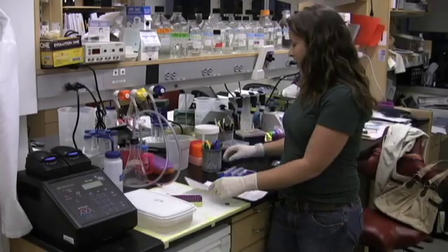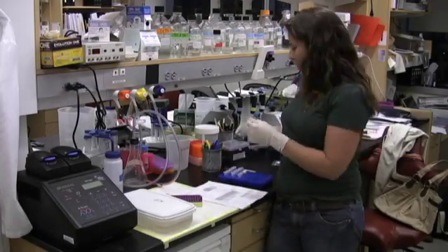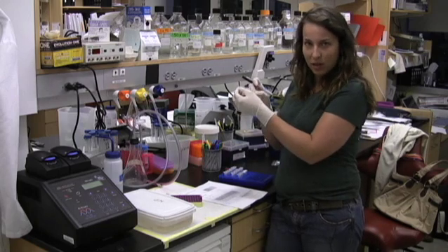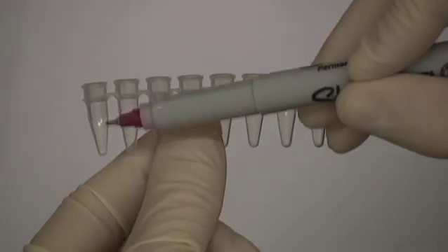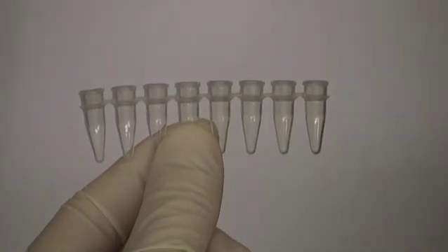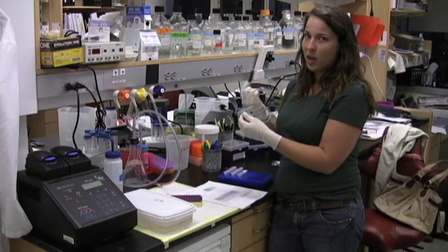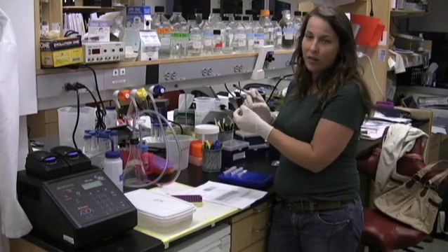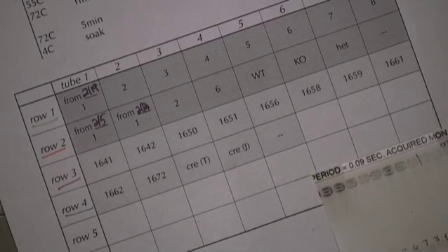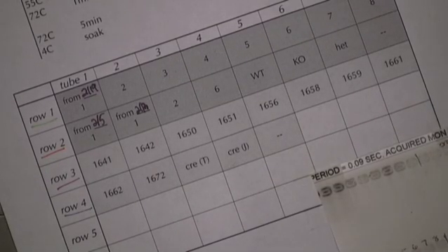Something that has annoyed me for a long time is that you can't write on the entirety of your PCR tubes, because at the bottom you run the risk of it getting rubbed off from the heat of the block. So you only have a very tiny area to write at the top. And as we all know, even the finest point Sharpie really doesn't write all that finely on the tubes. So I write down the different rows, and then I have a square for each of the tubes.